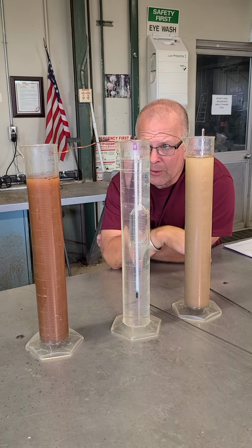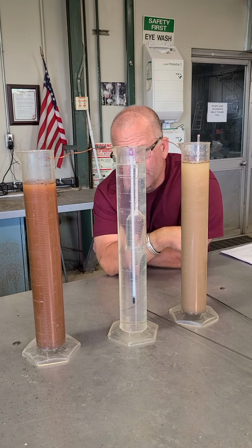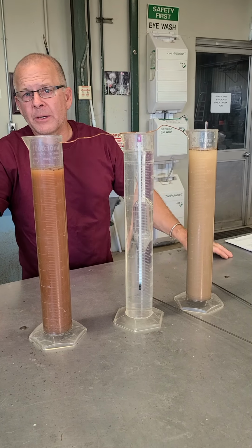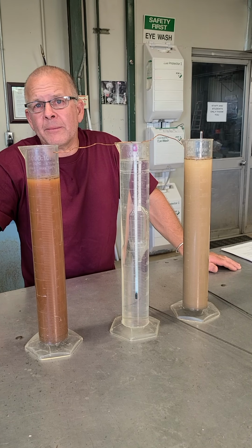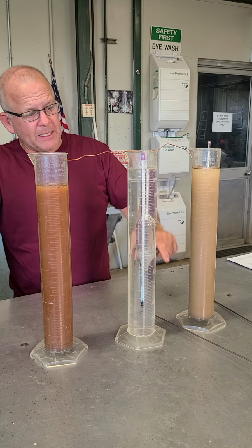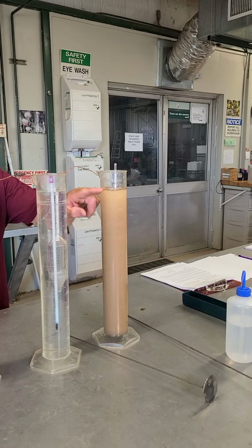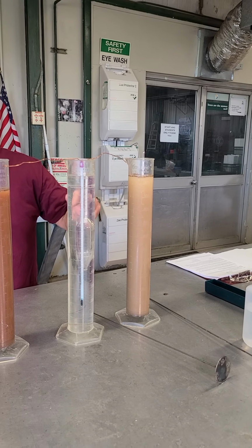So you said, okay, I haven't done this one yet, I know that, but I'll do that in a second. But you might be wondering, you've said 40 seconds, but you still have the hydrometer here, what's going on? Well, 40 seconds is the amount of time that Stokes' law says particles of a sand-sized diameter need to fall out of suspension. And if you look at this first sample again, you can see it's already clearing at the top. It's much darker down here than it is up here, and it's only been a couple of minutes.